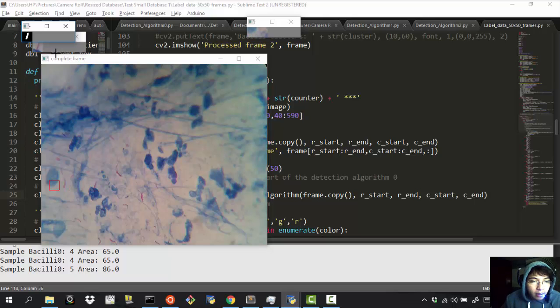So this is what you can do with the program right now, and well, that's it for the video. I'm classifying the images using this program. Oh yeah, what I forgot is that, for example, if I say this is a bacteria, then I press B to classify this as a bacteria, and I press N to classify this as anything else.